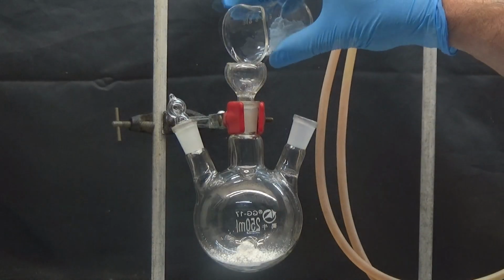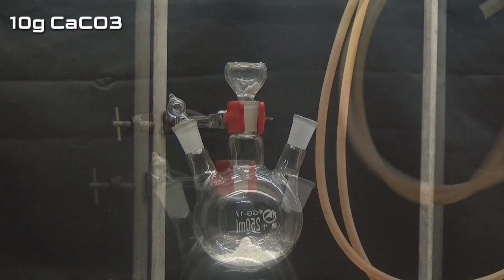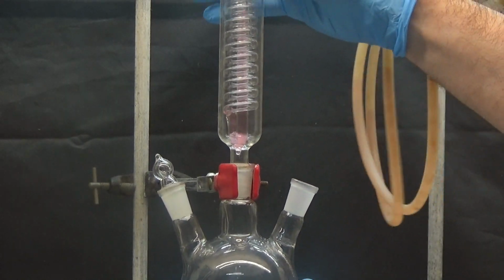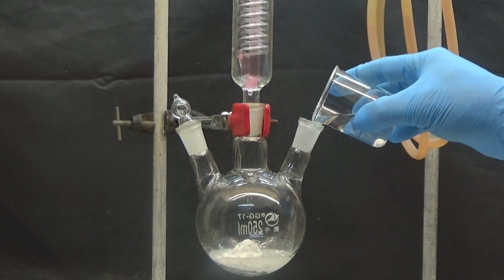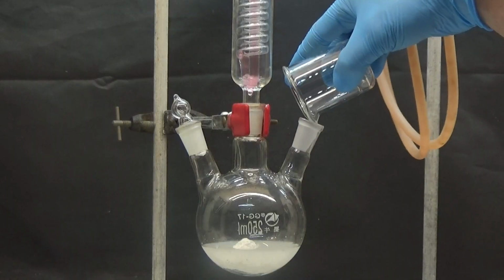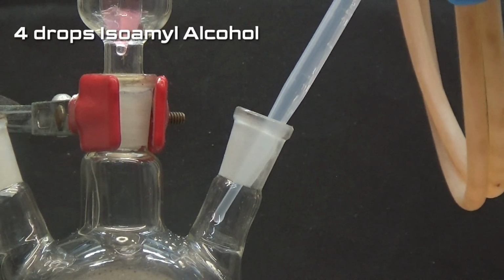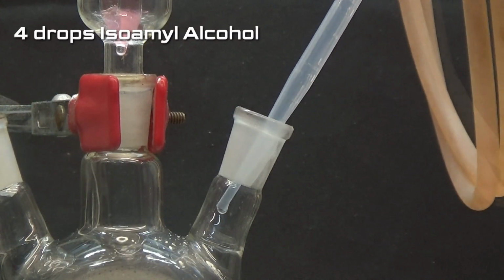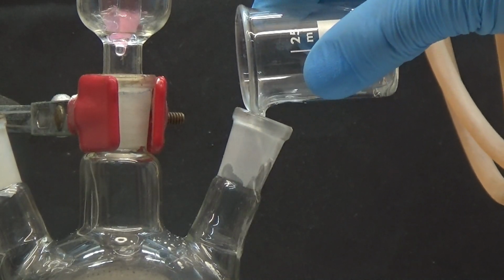In a 250 ml three-necked flask put 10 grams of calcium carbonate through a solid funnel. Put a reflux condenser in the central neck. Add the chloral hydrate solution, four drops of isoamyl alcohol to avoid foam production, and add the sodium cyanide solution, and put in a 200-degree thermometer.